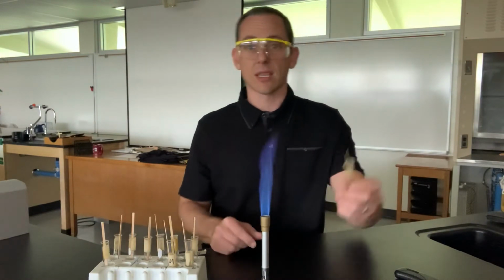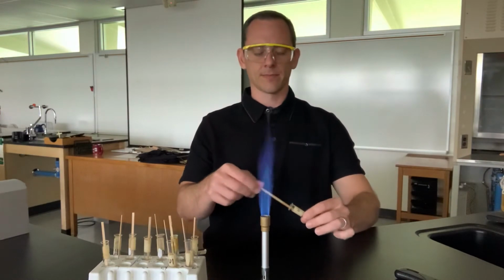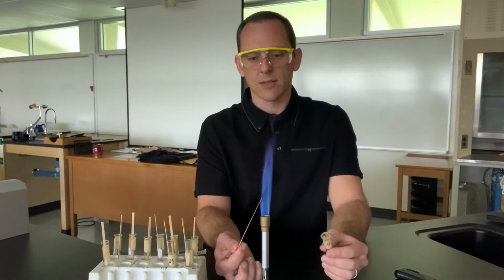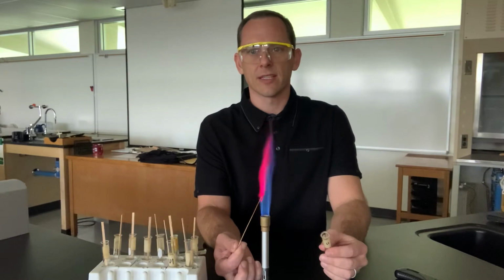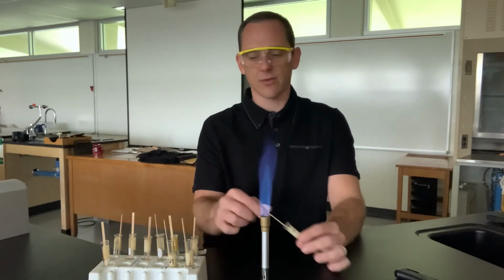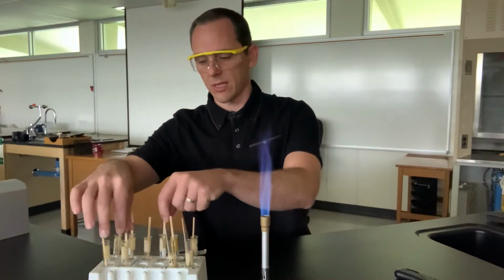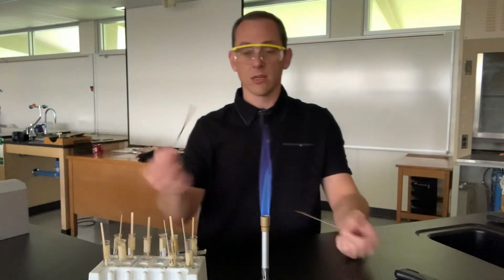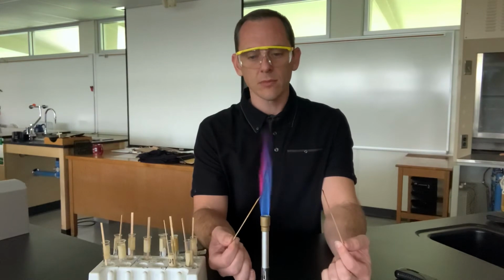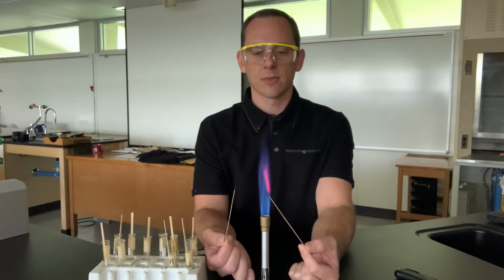And then this one is lithium. Here's the lithium. There it is. Now sometimes people go, wait a minute, we saw one like that already. No, this is very different. I'll compare it. The one that most people get confused with is strontium and lithium. So we'll show those side by side. So here's lithium. And then here's strontium. Give it a second. There it comes.